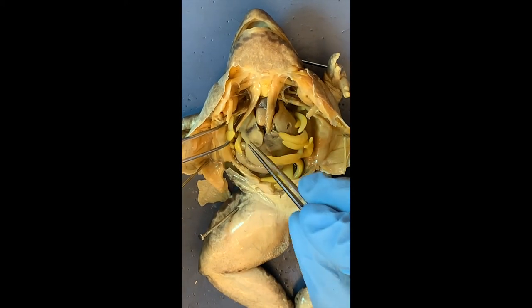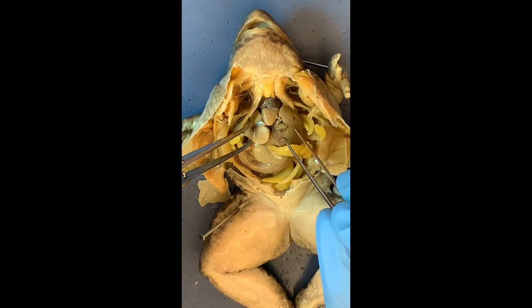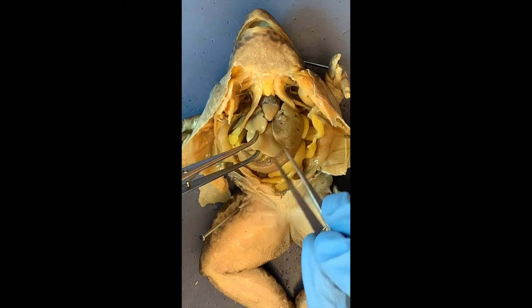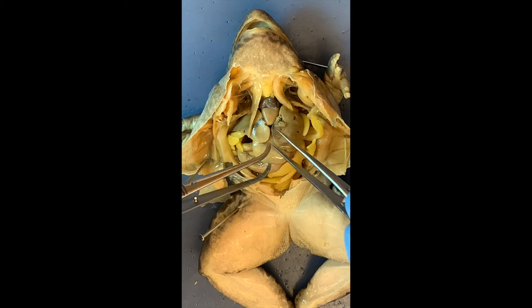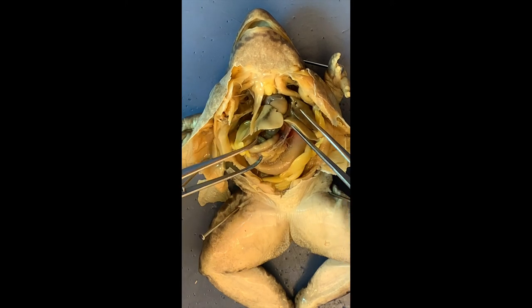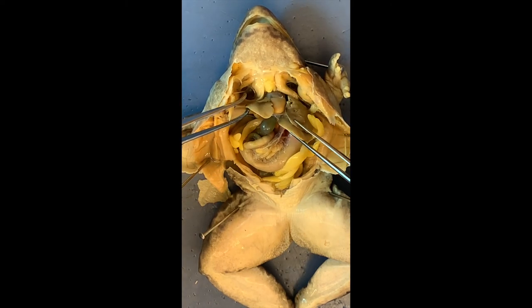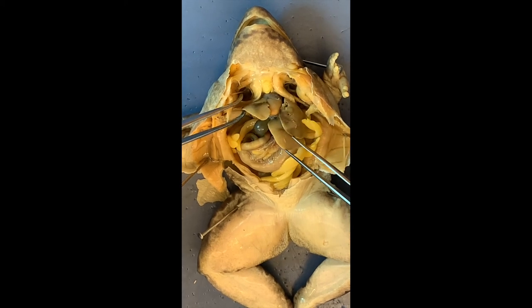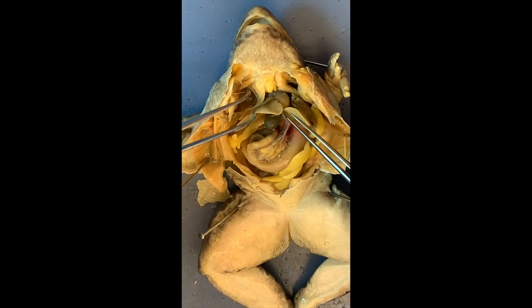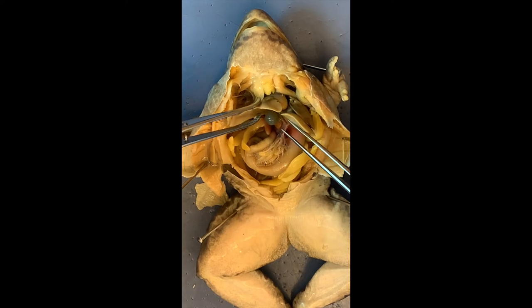What's that large organ we see all over? It's gigantic — the largest organ in the body, with different parts. It's the liver. The liver has many functions — that's probably why it's so big. It's involved in digestion, storing glycogen, detoxifying the body, and making bile for digestion. And look at this big pouch here — that's the gallbladder. The bile is made by the liver and stored in the gallbladder. I'm not going to poke it, otherwise we'll have that greenish-yellow bile coming out.